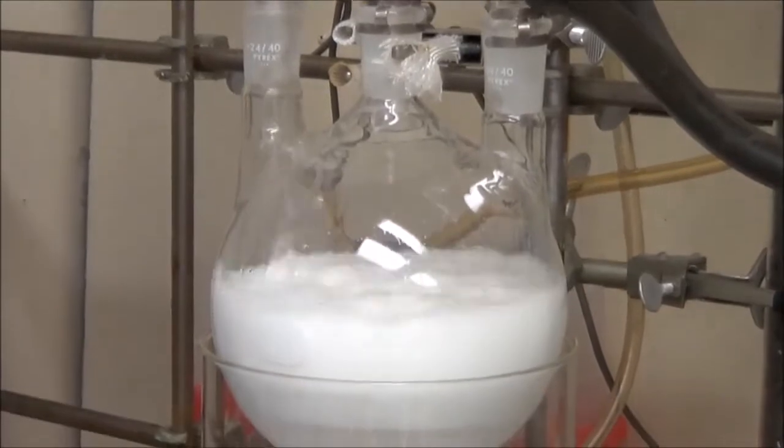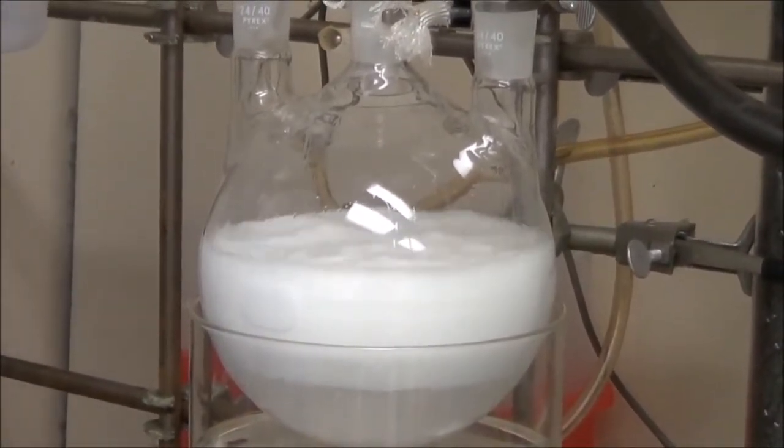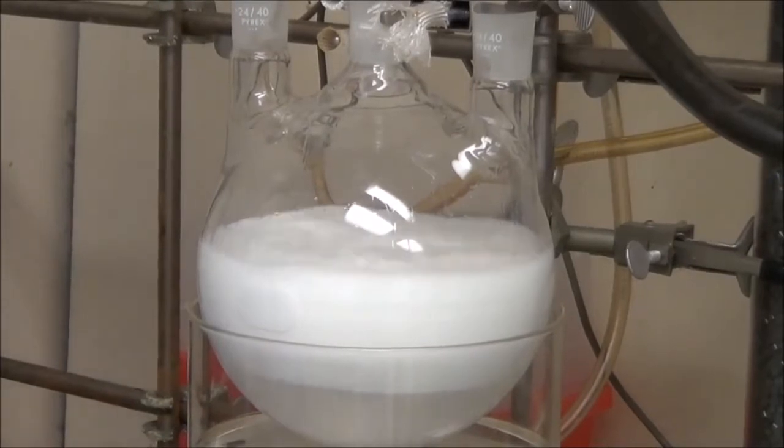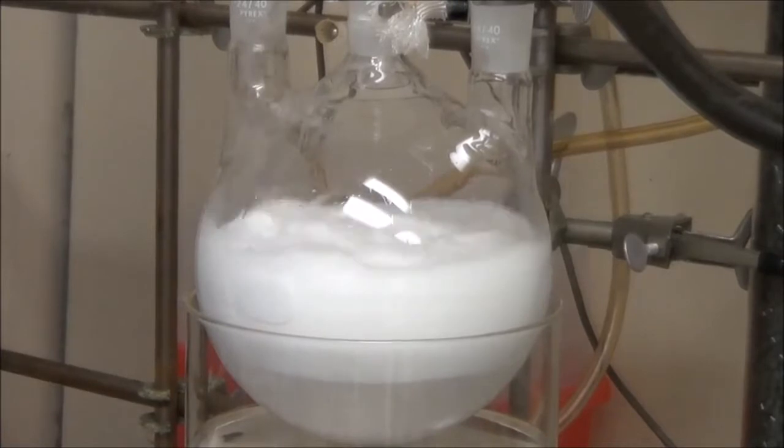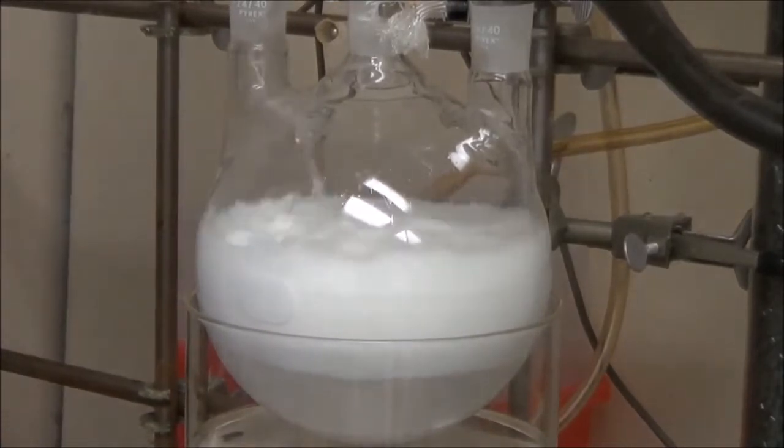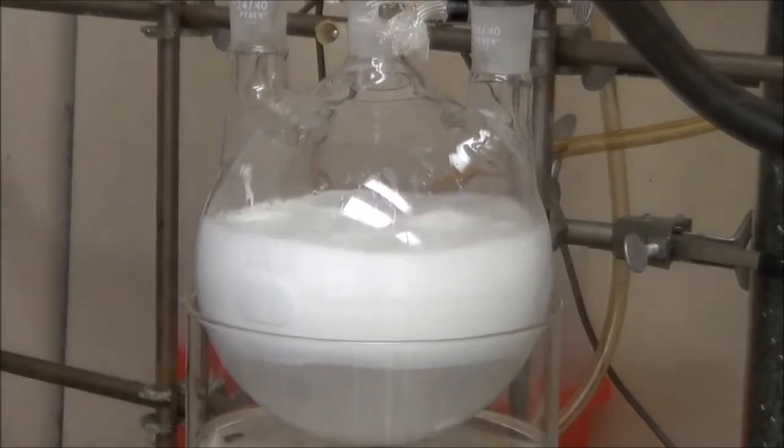That's just DI water we're pouring in. Unfortunately, the product is an amphiphile. It's basically soap. That means that the separation is actually difficult because the aqueous layer is going to form an emulsion. When you try to remove the aqueous layer, you're going to actually end up removing a lot of product, and you don't want that. So you need the best separation possible.